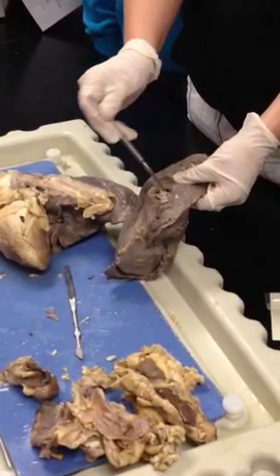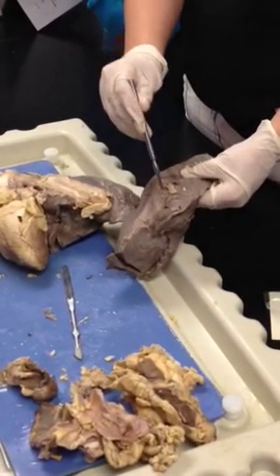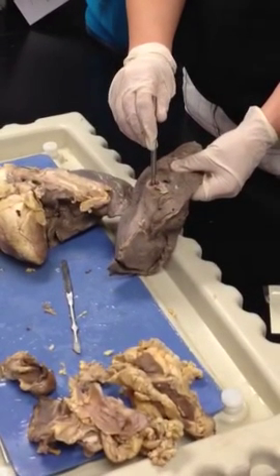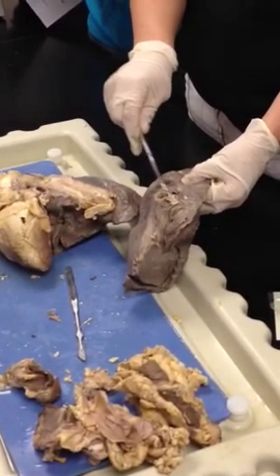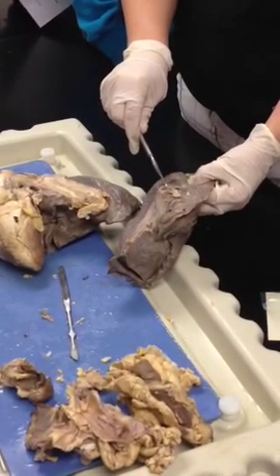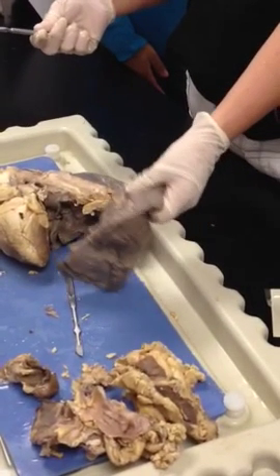So we basically can put little dots in here and you have to be able to tell me if this is a pulmonary artery, the pulmonary vein, or the primary bronchi. Understand? So a big thing is that the artery is much thicker. The vein, the walls are really flimsy. They're very flimsy. So you have to be able to tell the difference on a dissection, and we'll ask you.